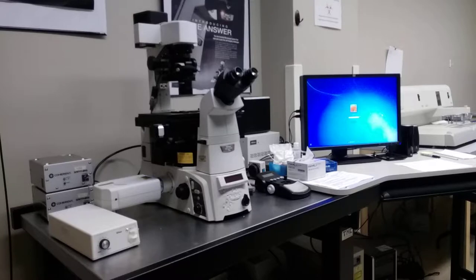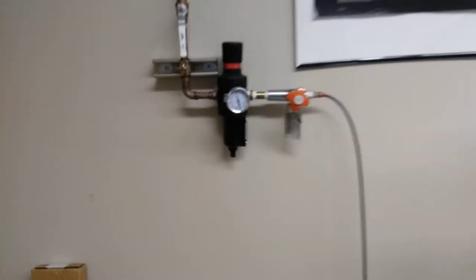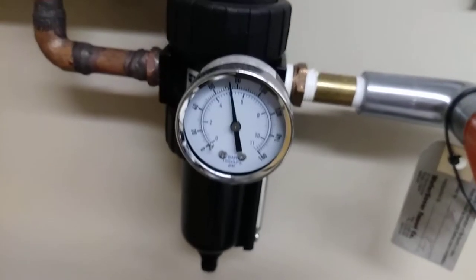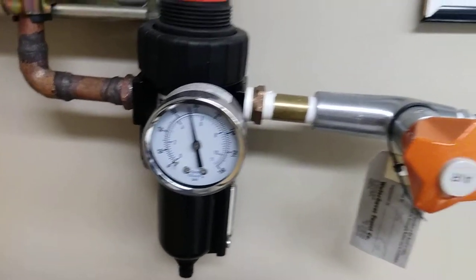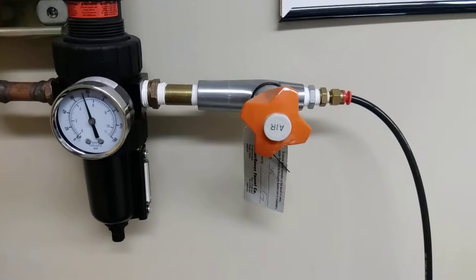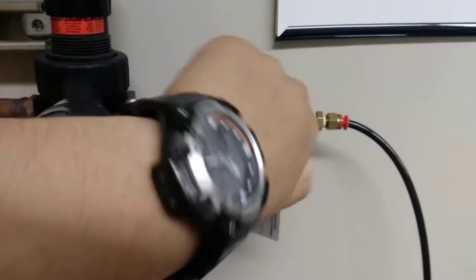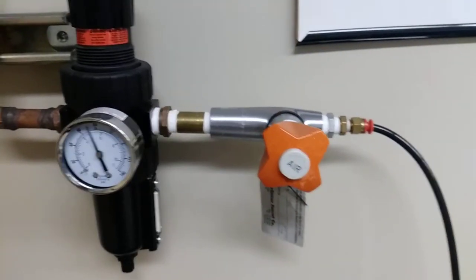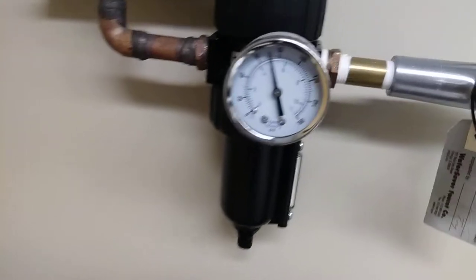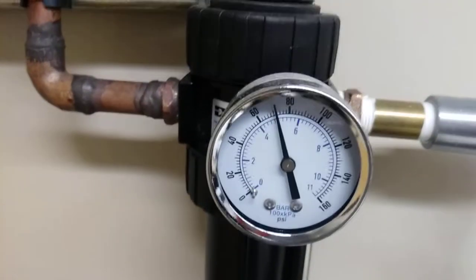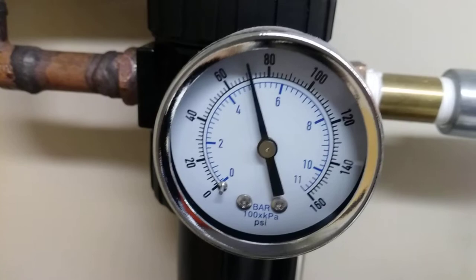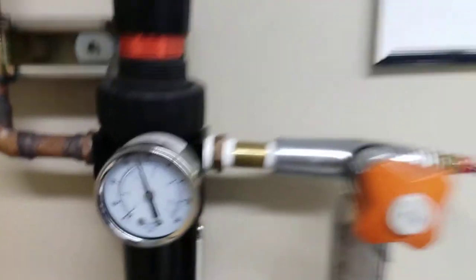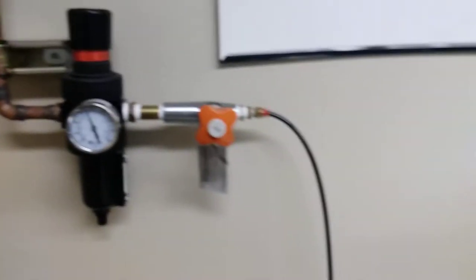It's pretty simple. The first thing you want to do is go over here to the valve for the air. It was recently turned on. As you can see, there's still air in the lines. So what I'm going to do is turn it to the left here. If this was off and you turn it to the left at least one or two rotations, that should turn on the air. And this is what you should read, somewhere between 60 and 80 psi. So if that reading is correct, then you're good.